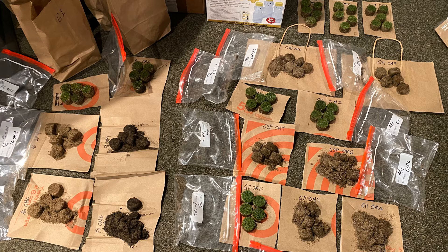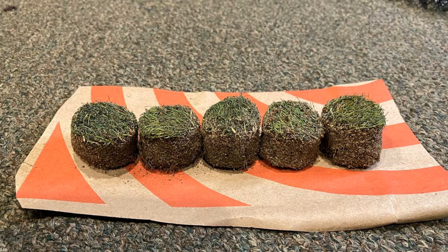The samples were air dried immediately after sampling. I recommend drying the samples to stop microbial activity prior to shipping. I recommend a standard procedure to take 5 subsamples per green at every depth that you want to test. This is the 5 subsamples from the 0 to 2 cm depth from the 9th green at Hazeltine after they were dried in the office and just prior to shipping.